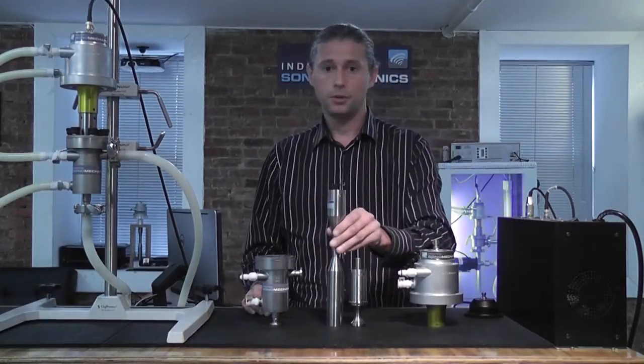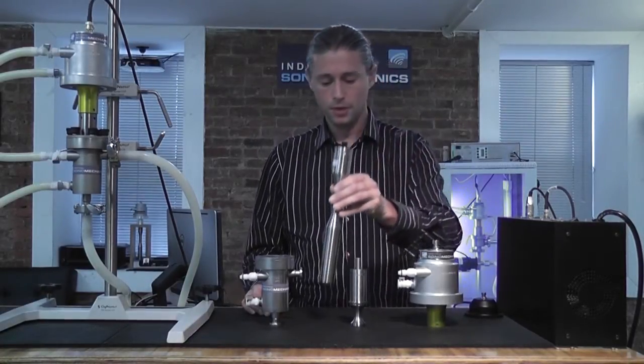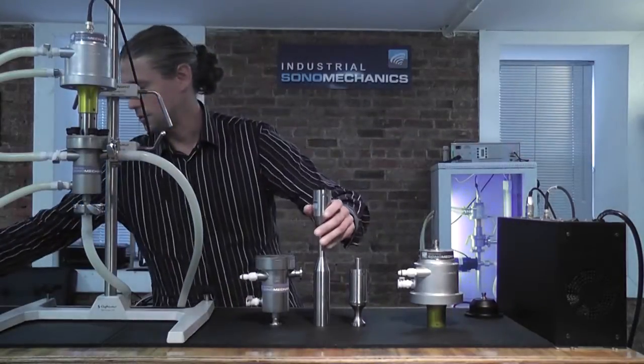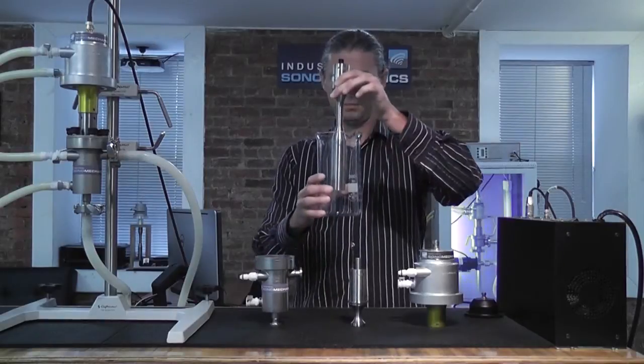The other very commonly used barbell horn is the FBH, the full-wave barbell horn, which is used in combination with, for example, a beaker for batch processing.